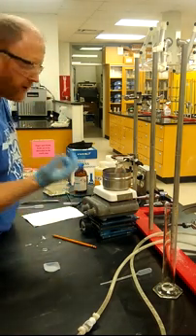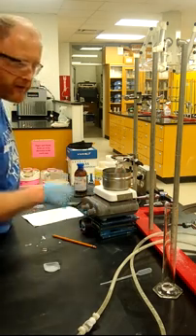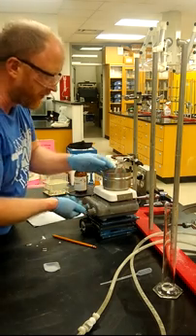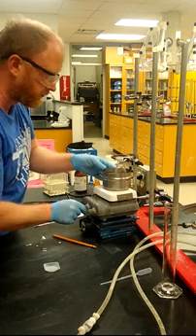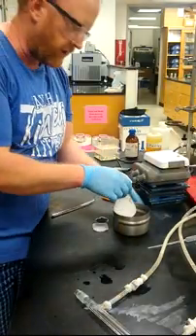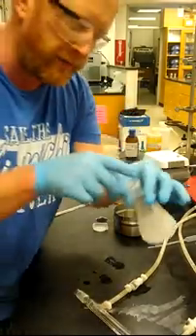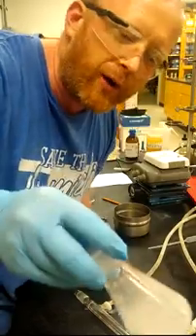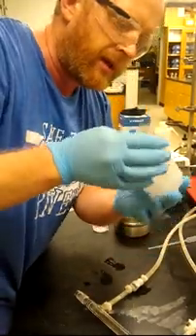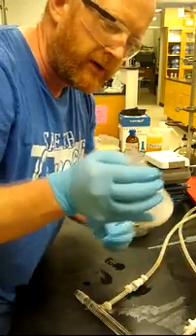After our cold water has all been added, we're just leaving it to sit without stirring in the ice bath, occasionally turning on stirring for just a moment to mix things, then turning it off again. After your time in the ice bath, you should have a significant amount of solid at the bottom of your flask — hopefully you can see the solid in there.